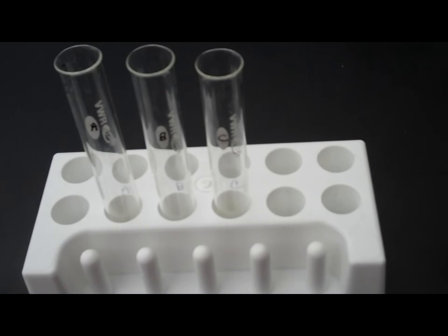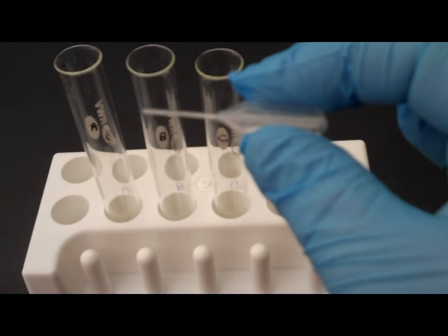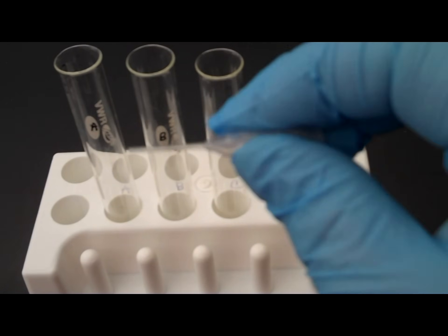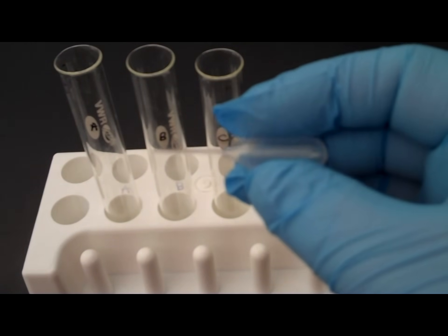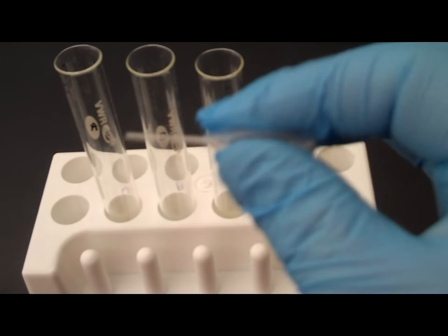Now, I picked up these at a lab supply company. I thought they were just the greatest little things. They're little pipettes, and each one of these will do a half a mil per squeeze. And they're disposable, so they're really easy ways for you to dispense stuff and not take up a lot of space in your lab.